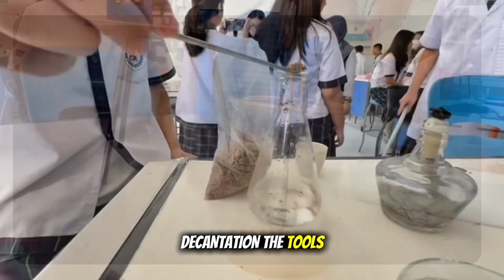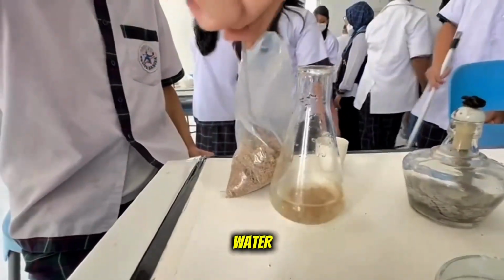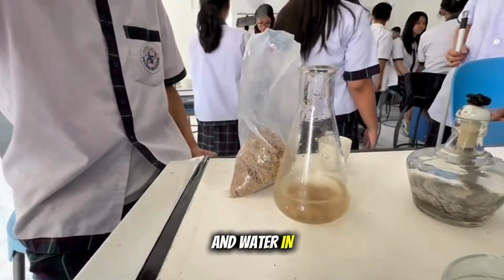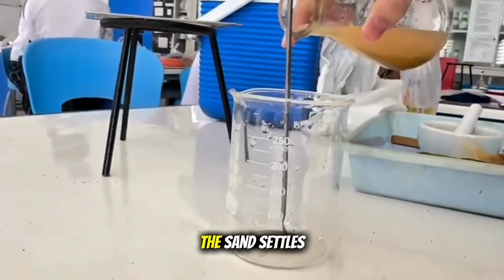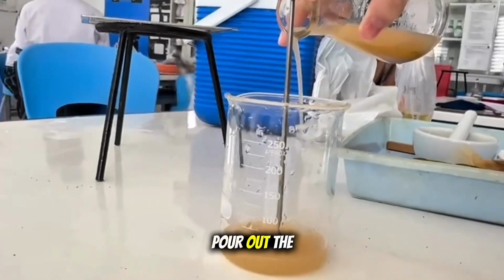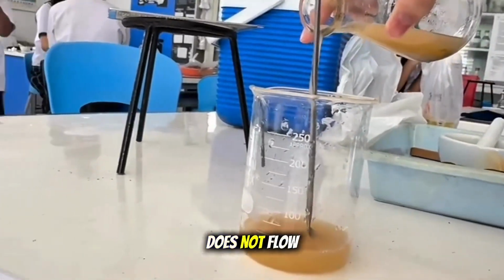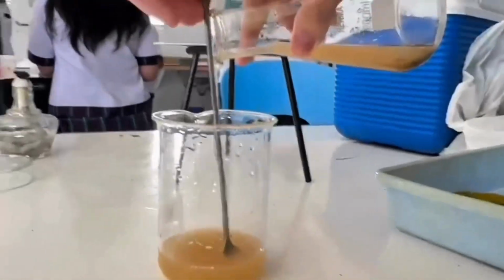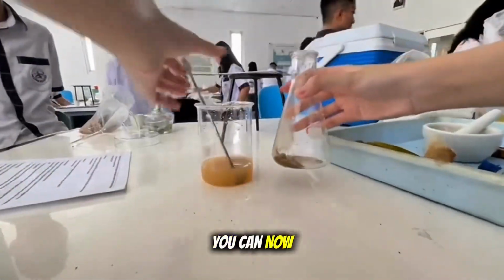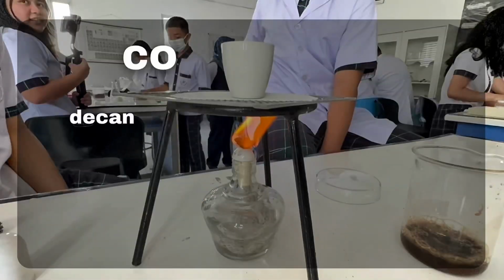Decantation. The tools needed are a beaker and a spoon, and the materials needed are sand and water. First, mix sand and water in the beaker and wait until the sand settles at the bottom. Next, tilt the beaker slowly to pour out the water. Use a spoon to hold the sand so it does not flow out. You can now analyze the result that the water and sand are separated.